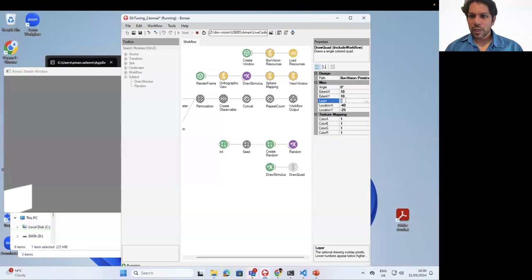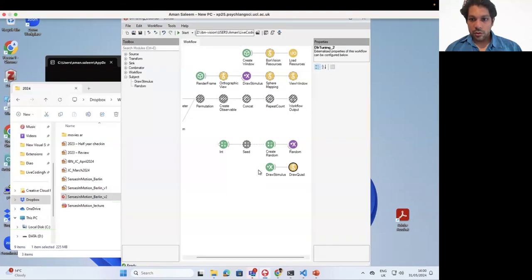In general in BonVision, we do have the option of putting layers, so we can overlay things. I would put this on an upper layer that is presented on top of any stimulus. So even if there's a stimulus in the back, this would be the one that is presented last, and this one gets priority. That's because we want to make sure that the sync is what is being shown, even if by mistake a stimulus is placed behind in that position, it just goes behind rather than in front of the sync pulse. Okay, we've put a quad in the position where we want to put the sync pulse. So when we put a photodiode, we would put it looking at this part of the screen. Now, okay, so we've got this quad.